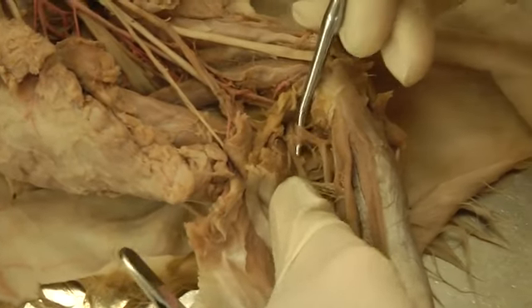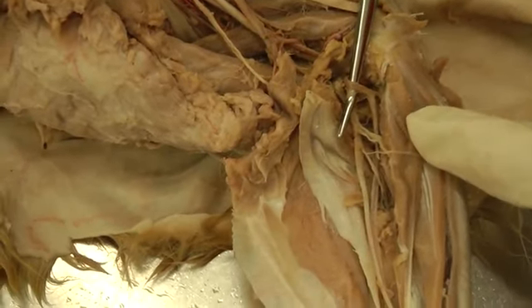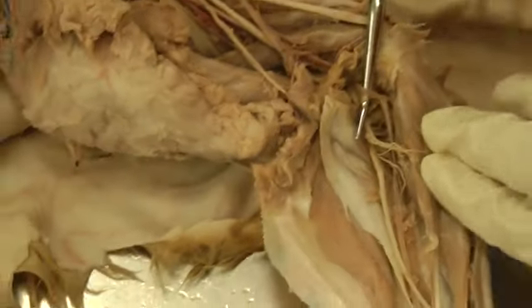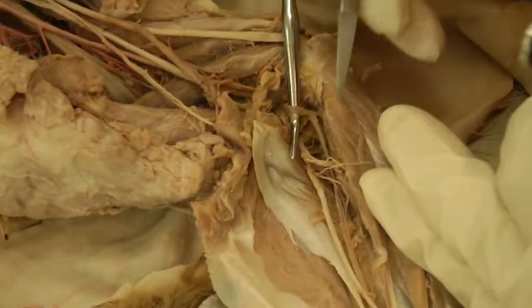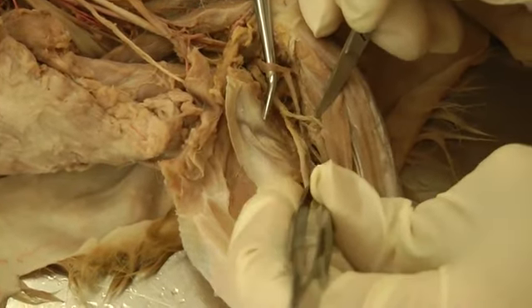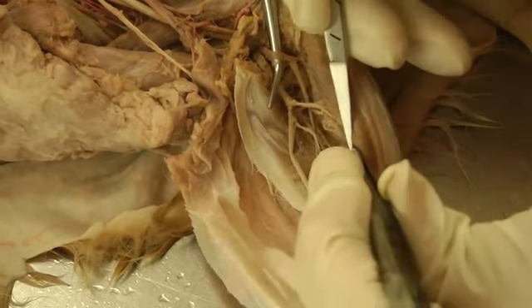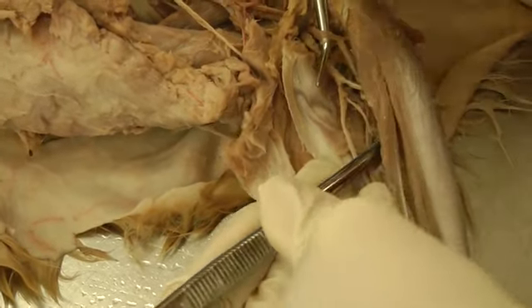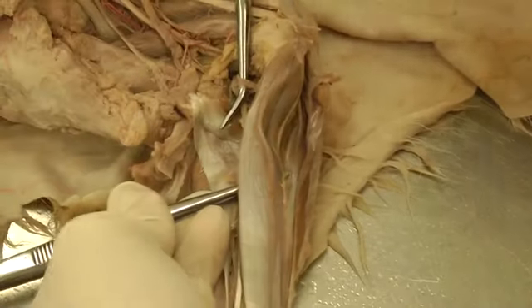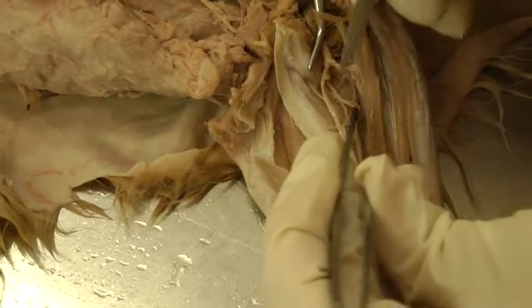Unfortunately in the cat, I don't have injection at this point, so we don't have a lot of color, but that will be the brachial artery. The cat does not have a common interosseous branch, so everything comes off separately. If you put your forceps around it and pull the muscles apart, you can see the ulnar artery here going caudally.